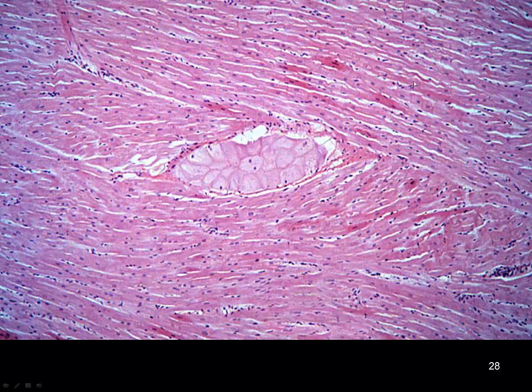It almost gives you the impression that we're looking at dense, regular connective tissue, but these nuclei are around. There are vastly so many more of these nuclei present. We don't really see a good banding or striated pattern. We might have a hint of it down here, but certainly these are interwoven and interconnected sheets of tissue.